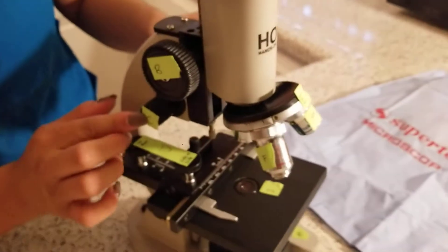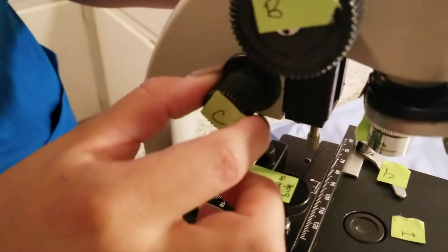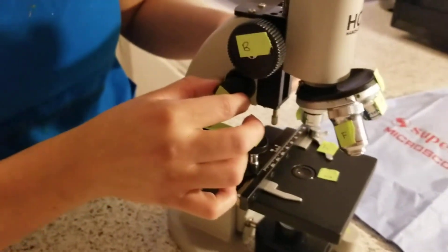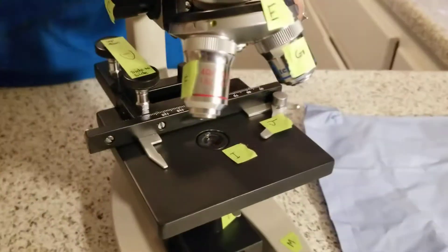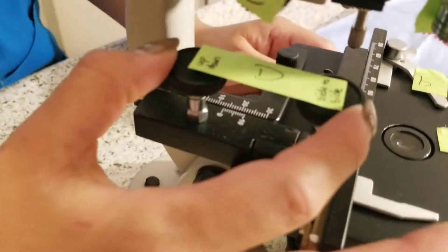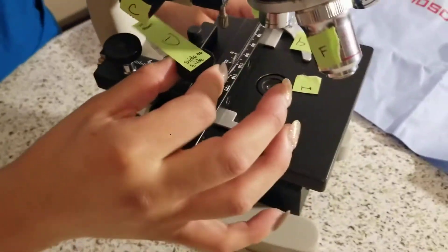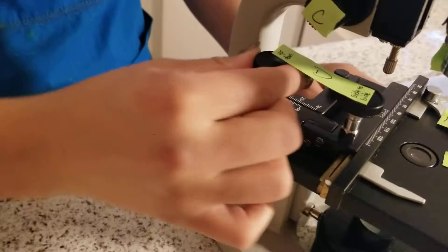Then I have C, which will be the fine adjustment. This is used for higher magnification lenses to focus on specific parts of slides being evaluated. Then I have part D. There are two of them. They're called the stage adjustment knobs. They're used to move the slide around — this one moves the slide from side to side, and then this one moves it up and down.